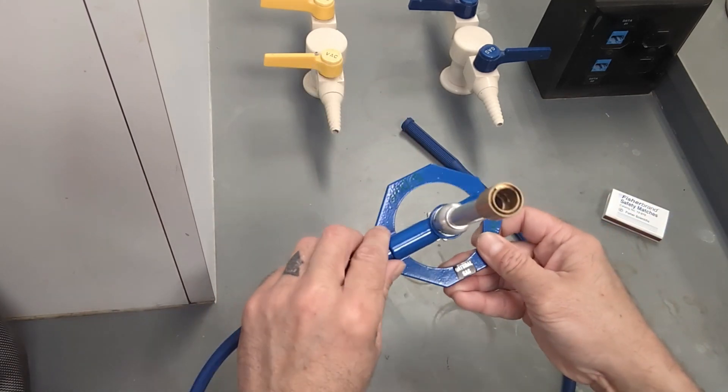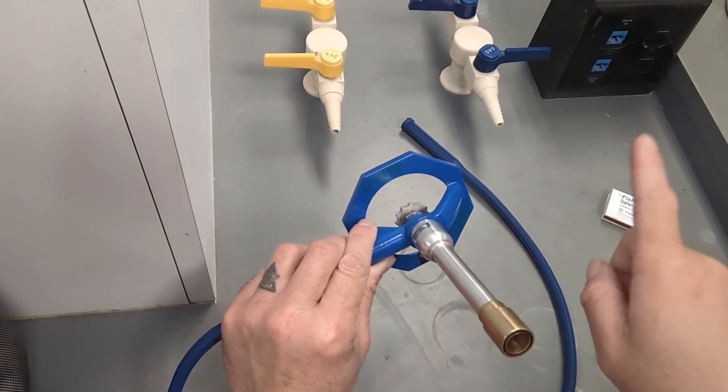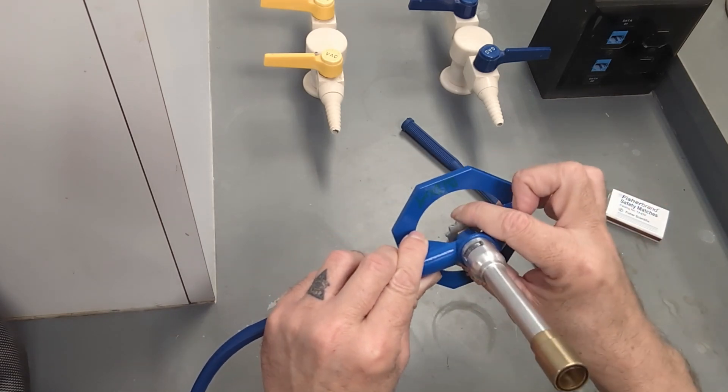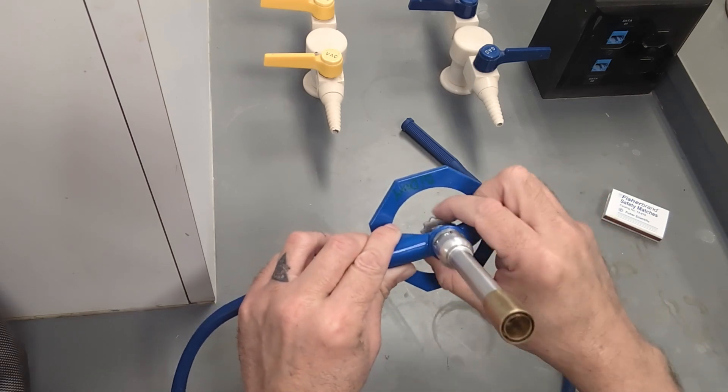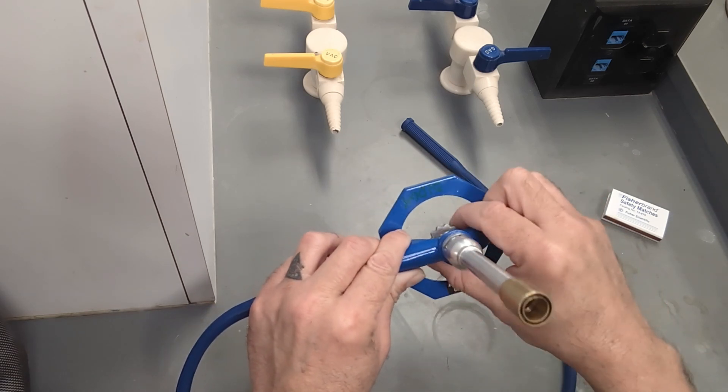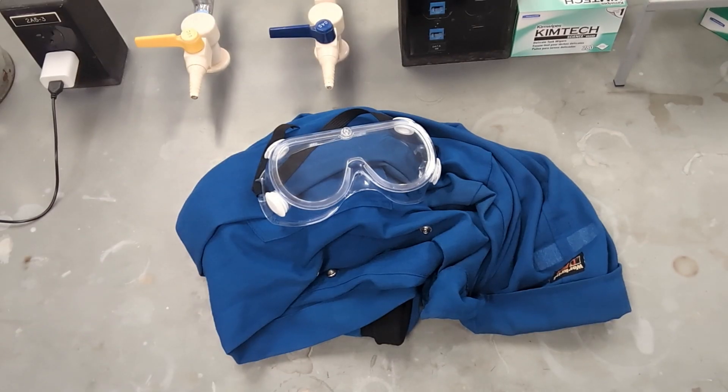However, looking at it from the top side, if you turn the valve left you are tightening it and if you turn it to the right you are loosening it. So left will be less gas flow and to the right will be more gas flow.